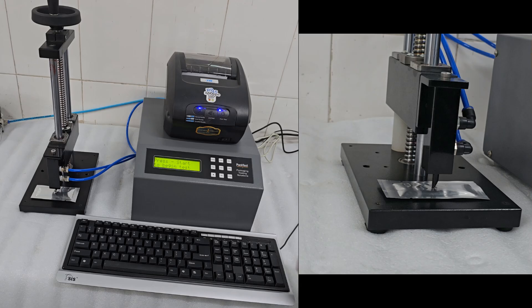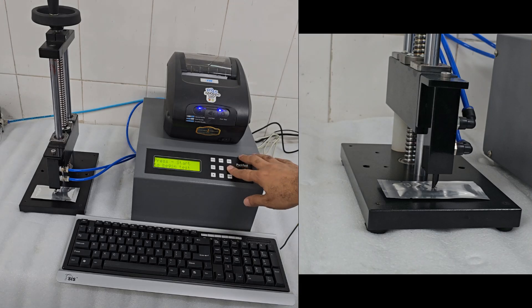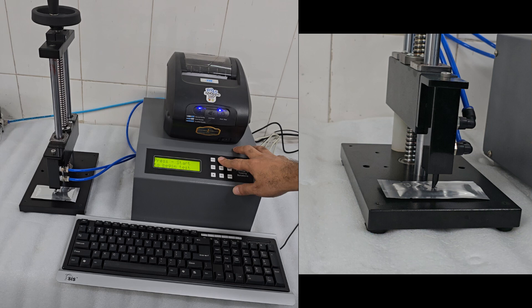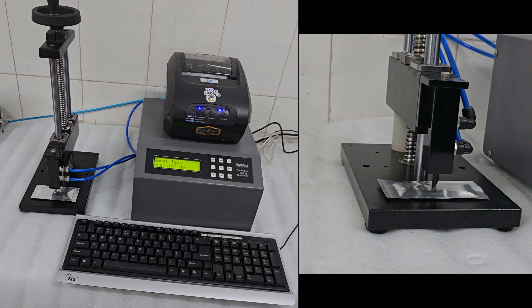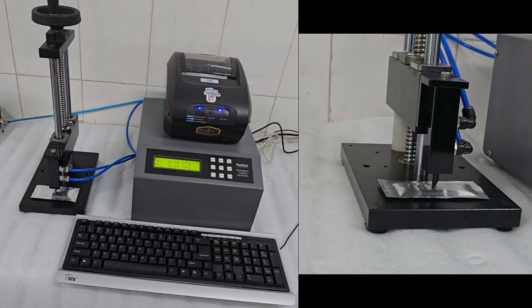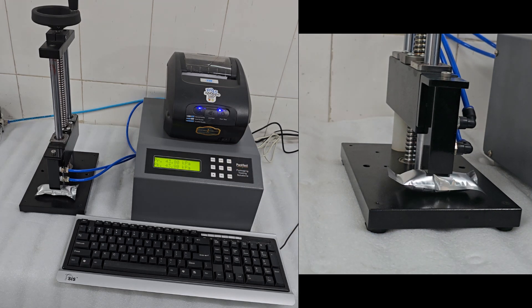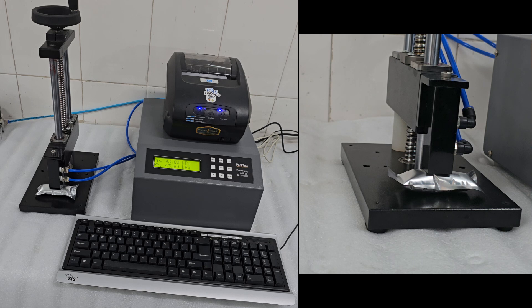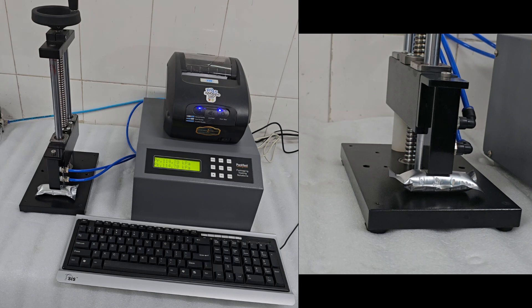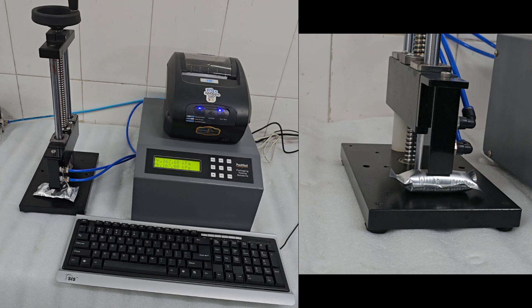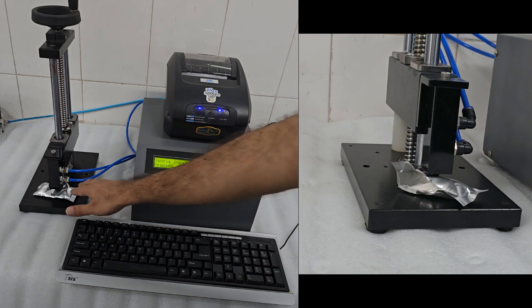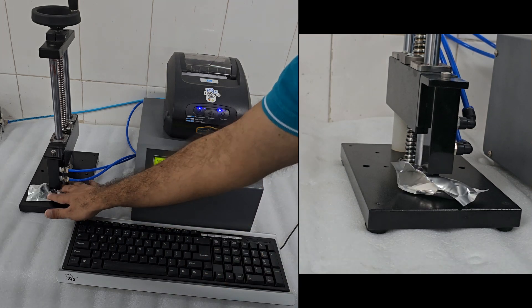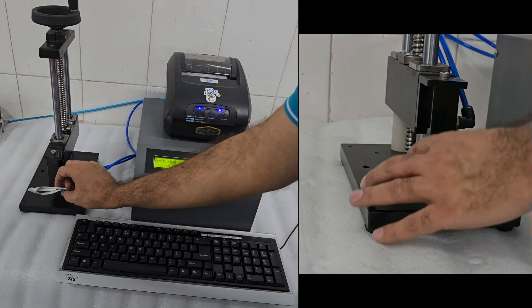Press 0. Then press Start. Air will soon start to fill up the pouch. Pressure will start increasing on the display. When the package cannot withstand the pressure, it will burst. The machine detects this burst point and stops the air flow.